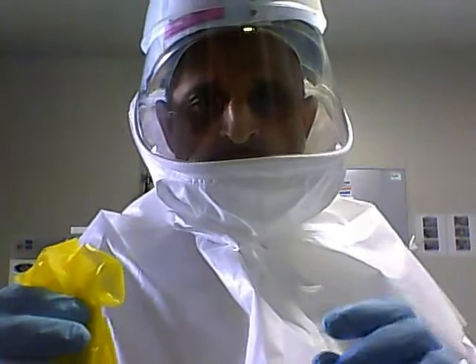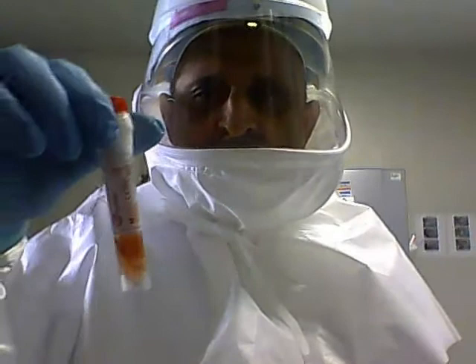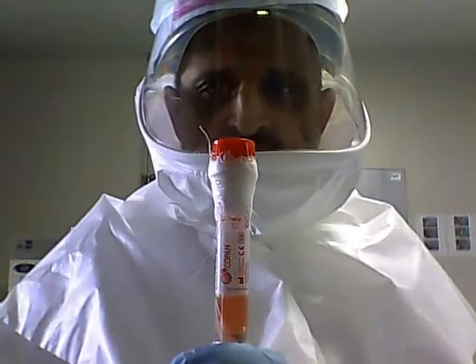We wait for around 30 seconds and open the bag after 30 seconds. The 30-second period is known as the contact time. Once you have opened your bag, you will obtain the sample. The sample will generally be shipped in a tube like this.